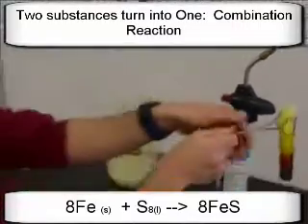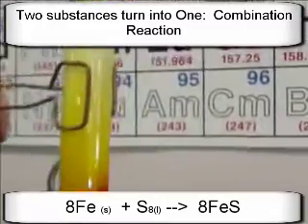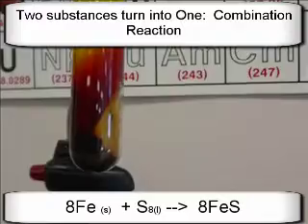Now, if you zoom in, you can still see some of the swirling hot gases there, can't you? That's vaporized sulfur up there. Lovely. I like that red. That's pretty cool.